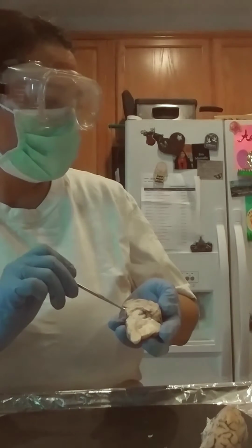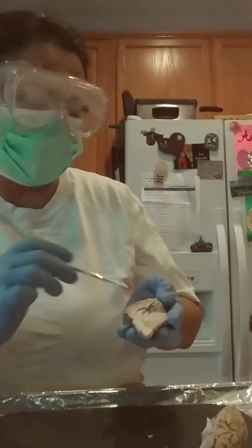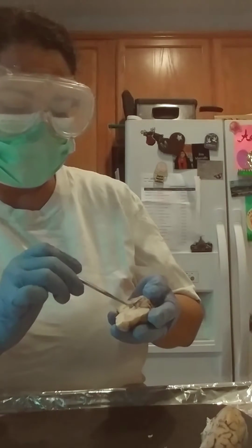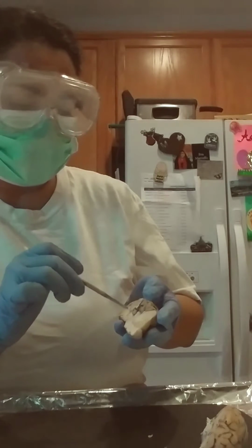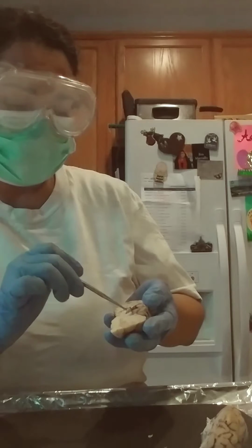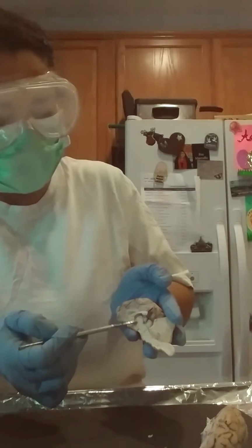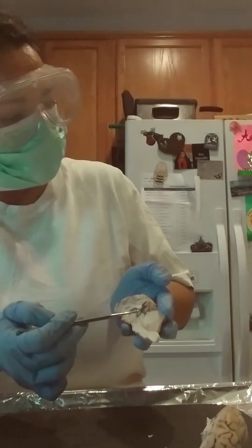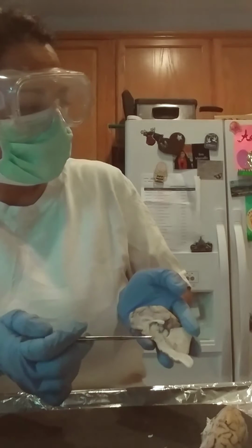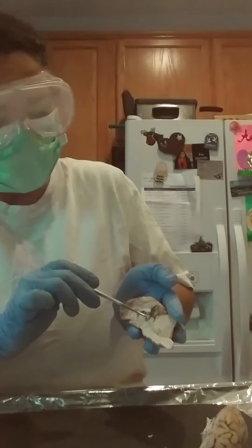This, let me see, okay, this area is the midbrain, and this little area here is the mammillary body. I hope you're being able to see it, sorry. Okay, so this is the thalamus, the hypothalamus. This is the midbrain, the mammillary body, I believe, next to the hypothalamus.